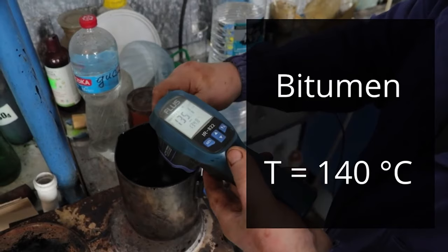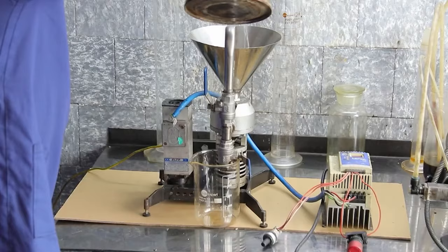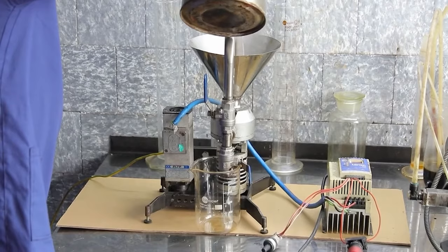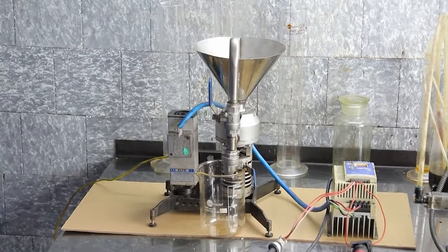Before preparing the emulsion, it is necessary to warm up a colloid mill. We feed water into the mill and turn it on. The mill operates and gradually warms up.